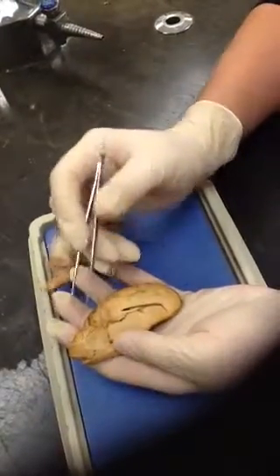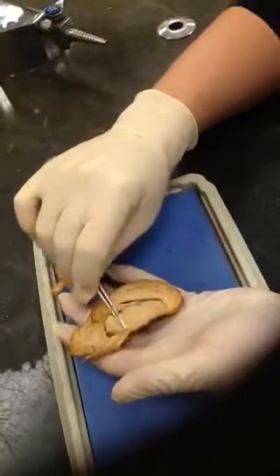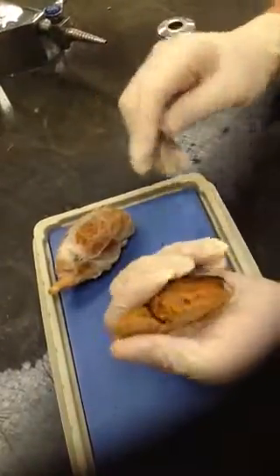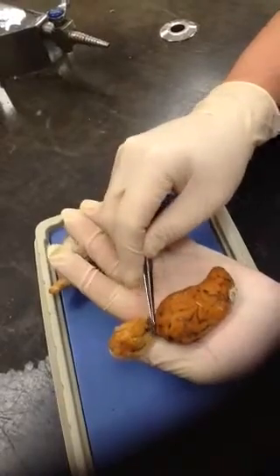Okay. We have two fissures that we need to know. One is the longitudinal fissure, which is where I've cut this brain, so into the left and right hemisphere. Get cut right along here. Okay. Then you have the transverse fissure, which separates the cerebrum from the cerebellum, right here.